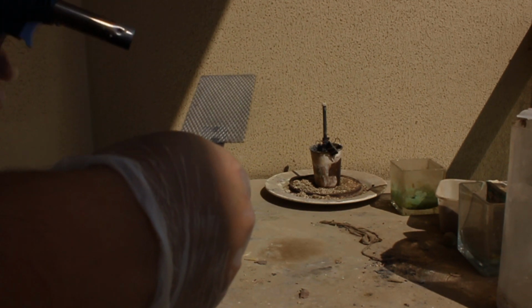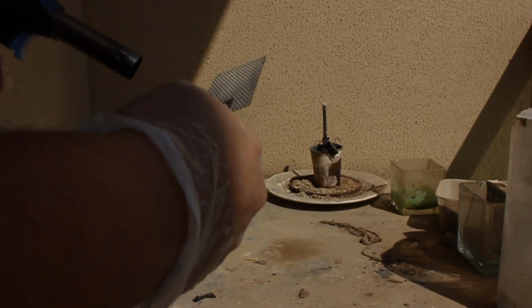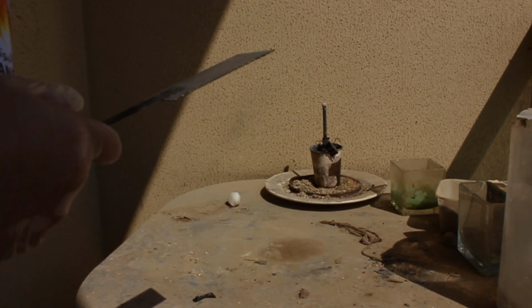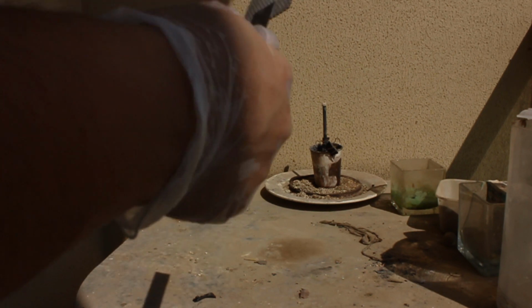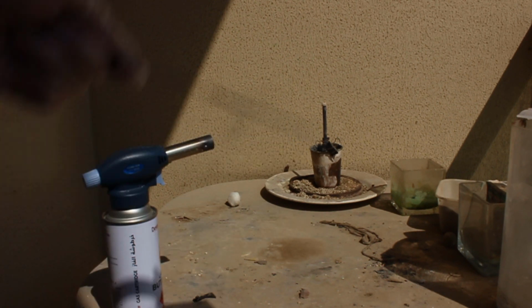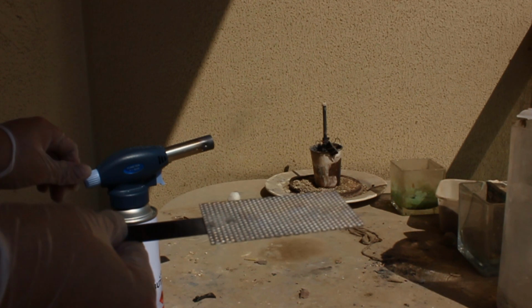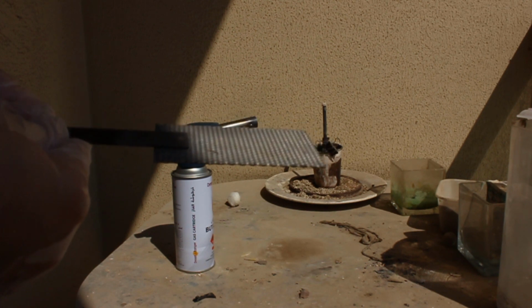If you bake it too hard, you're going to end up producing the oxide that we don't want now. We want that later. So once you see a yellowish gray, or some kind of medium gray, but don't heat it so strongly that it starts changing color, you're good. After you reach that point, you can lower your flame source, and you can do another layer of painting.